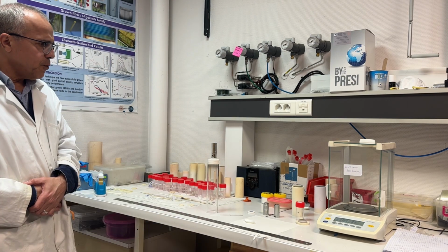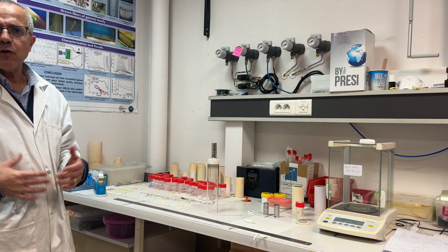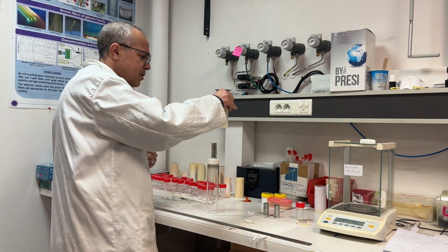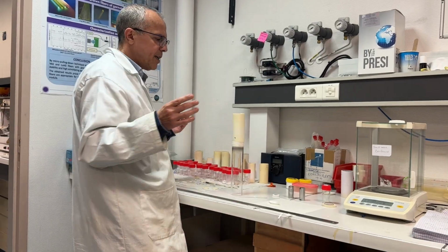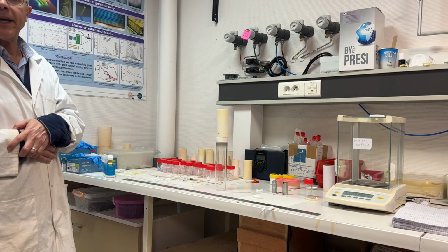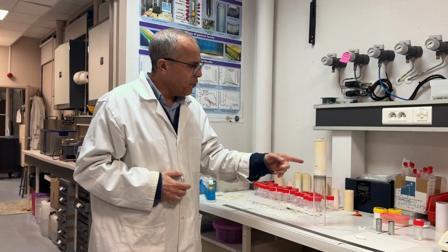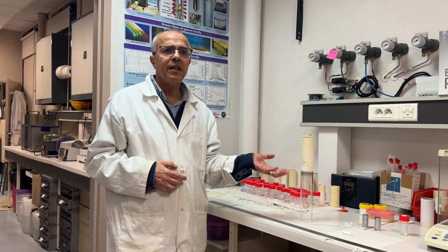Now I will show you how we use the ceramic insulation to save the power and heat the crucible and to control the thermal gradient. I close here with this tube. I put it here. Now you don't see anything because the crucible is protected by the alumina tube, and I close the top of the tube. We have a hole, and from this hole we heat, it becomes red.